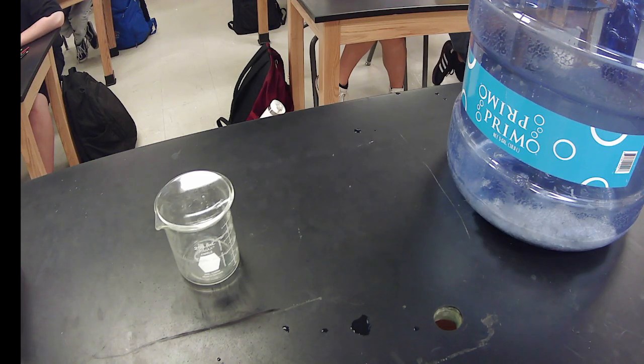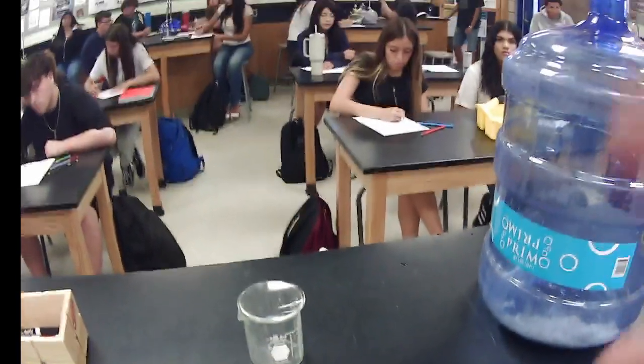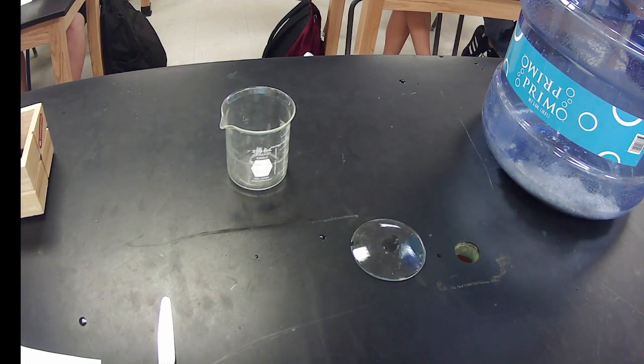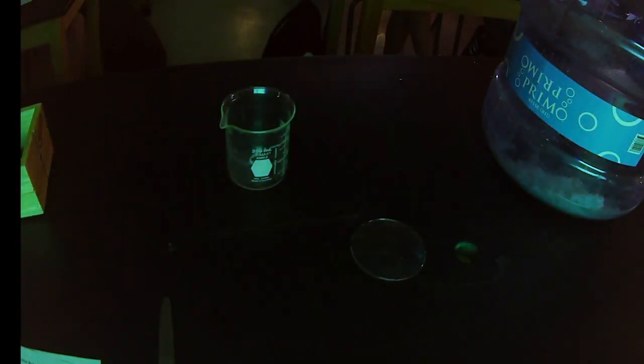Okay. So I'm going to have to back this up so they can see it. We're going to have a little bit in here. I'm going to turn off the light. All right, we're going to add a little bit of alcohol. I'm going to take this off so it's a little darker. Just a little bit. I'm not going to put a ton of it in there. And I'm just going to add some energy to it.